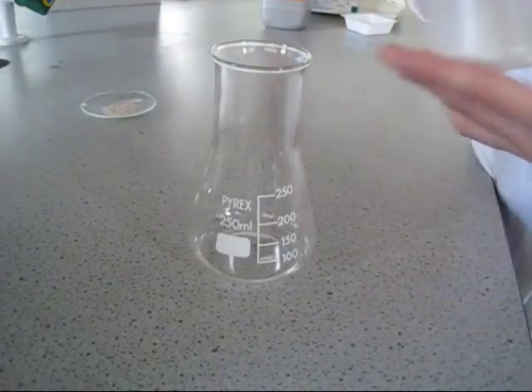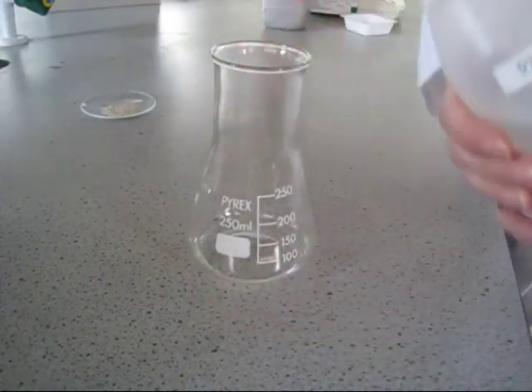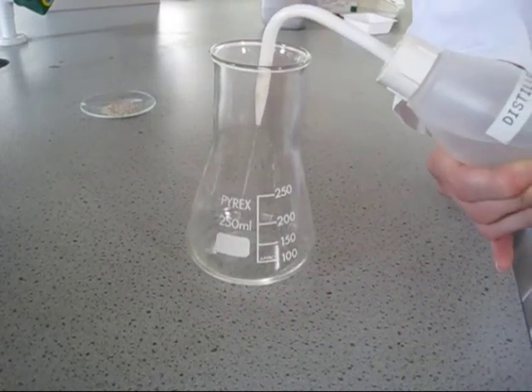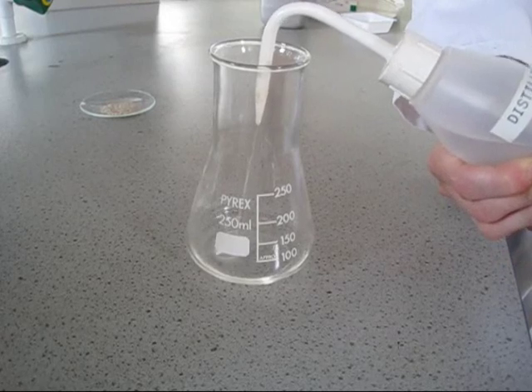To begin, take some distilled water and place it in a conical flask. We will then put this on a hot plate in order to bring it to the boil.